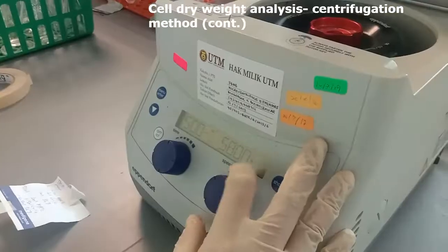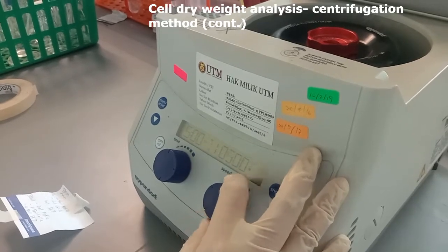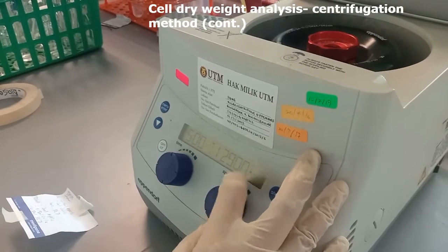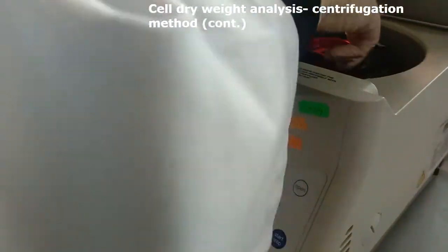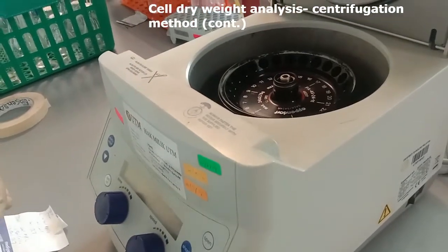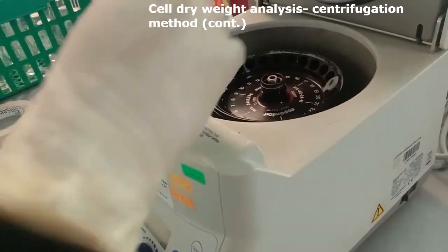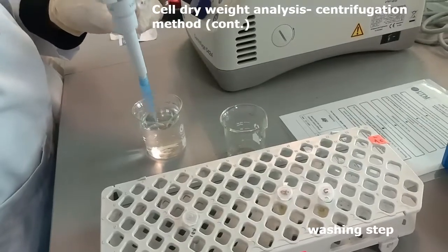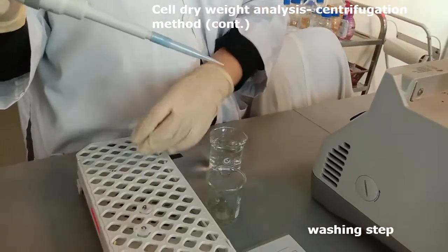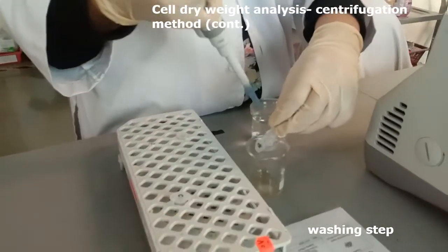And then centrifuge the tubes in order to obtain the cell pellet. Then wash the cell pellet using distilled water. Repeat the washing step 3 times for each sample. And on the last step, remove the supernatant and keep the cell pellets.